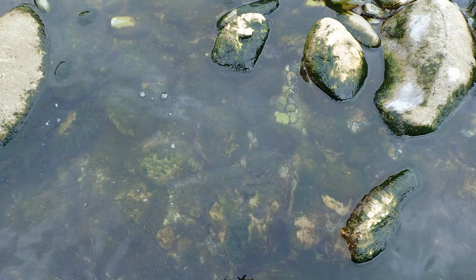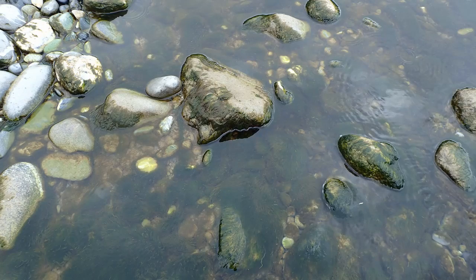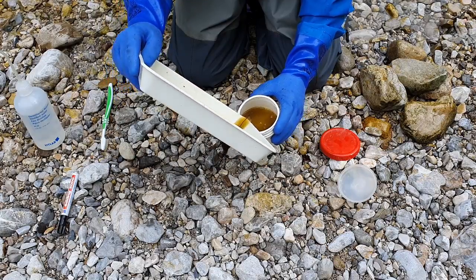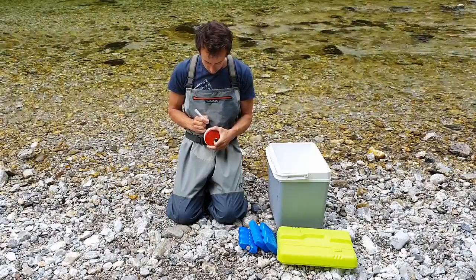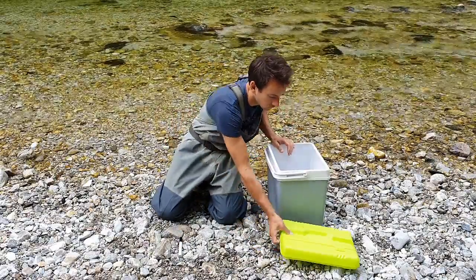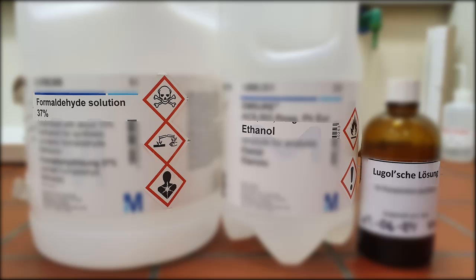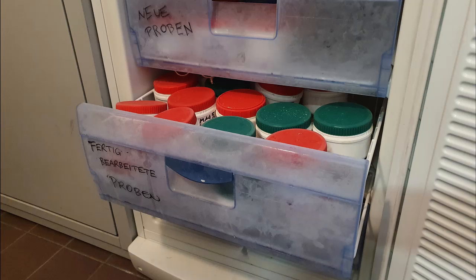If filamentous algae cover more than 75% of the substrate, diatoms have to be collected from the algal cover and the remaining surface of the substrate by scrubbing off the biofilm. The obtained brown and turbid diatom suspension is then transferred to the sampling container. The sampling container should be labeled with details relevant for identifying the sample and is transferred to the laboratory in a cool dark place, preferably a cool box. If samples are brought to the laboratory within 24 hours and these precautions are followed, it is not necessary to add preservatives in the field. If preservatives are necessary, they should be added immediately after sampling. Buffered formaldehyde or ethanol is suitable for long-term storage and Lugol's iodine for short-term storage. Alternatively, samples can also be preserved by deep freezing.